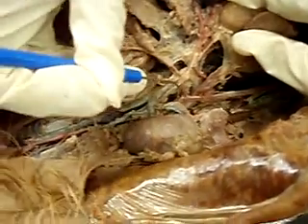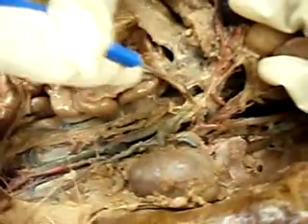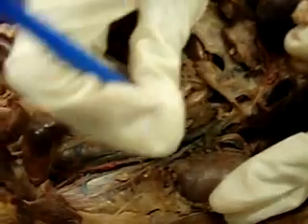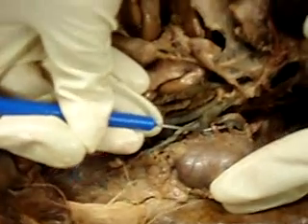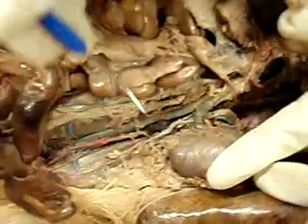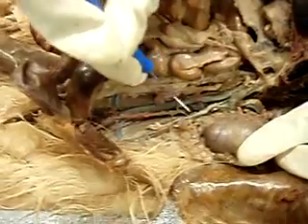So going back to the abdominal aorta, the second branch here is the superior mesenteric artery. Superior mesenteric. Below superior mesenteric, you have the kidneys, and then it's kind of small right here, but you can see the pink there. That would be the renal artery because it goes to the kidneys, renal artery.